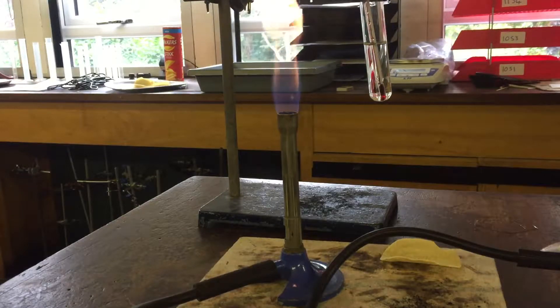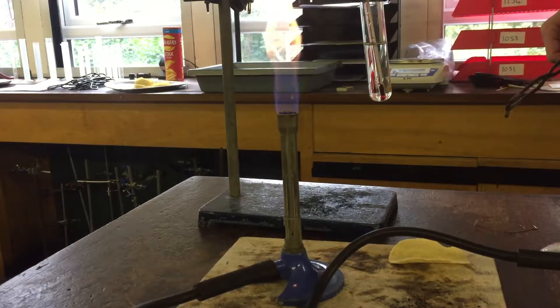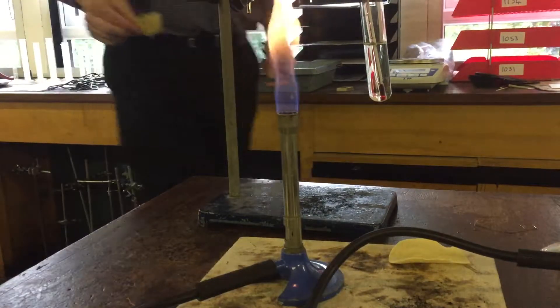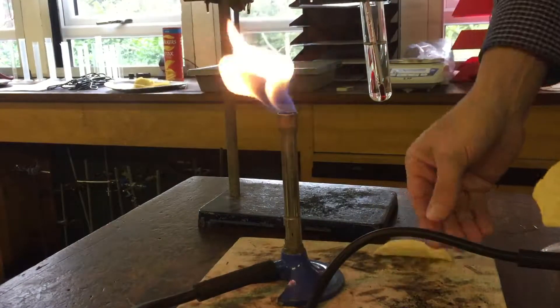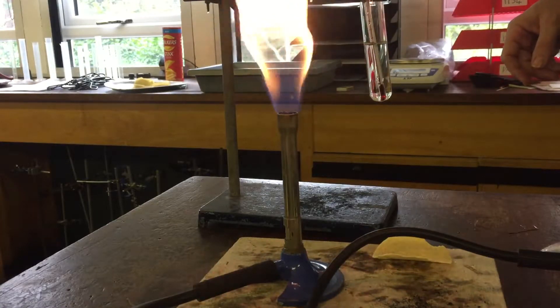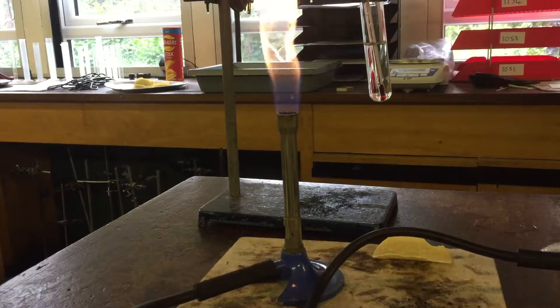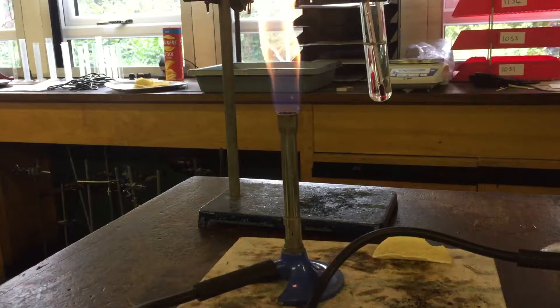We're going to test two different crisps: a high-fat Pringles crisp and a low-fat crisp. One obvious problem is that these two crisps are different sizes, which means different mass. So what we need to do first is weigh our crisps before the experiment to find their mass.